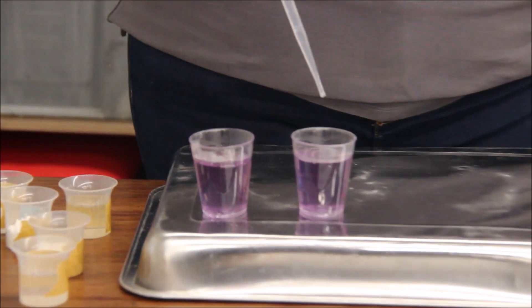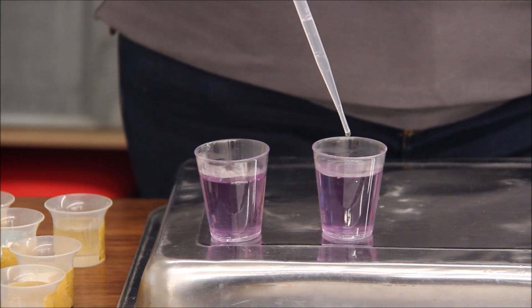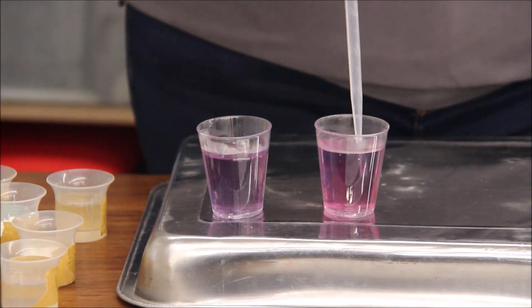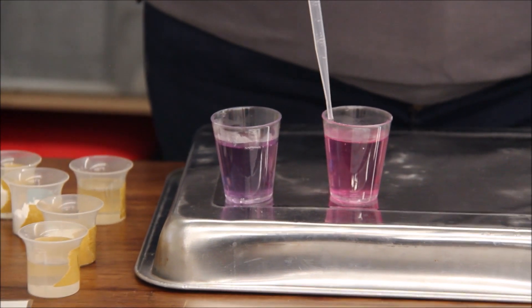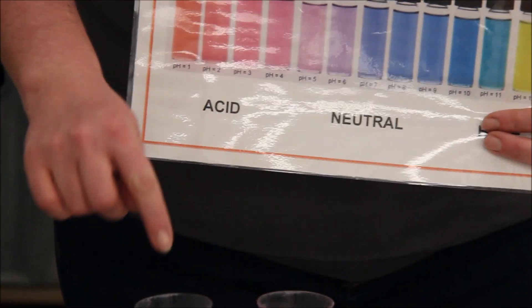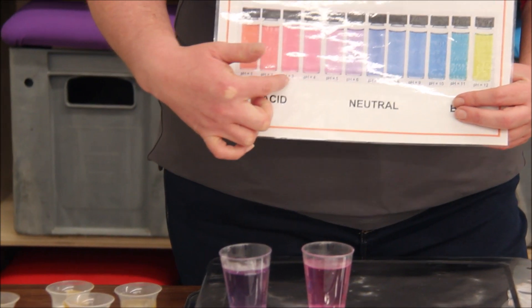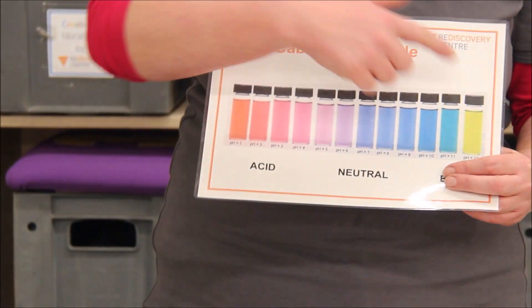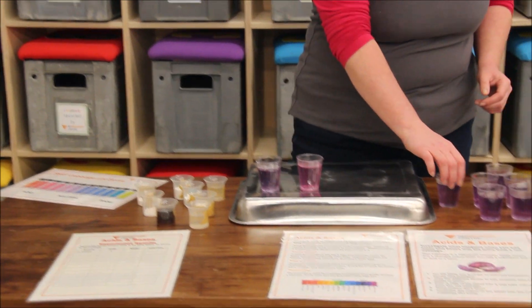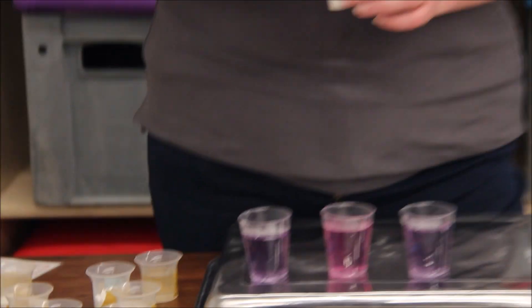I'm going to use my pipette and squeeze it in. So do we think this is going to be an acid or a base? Once I start adding it in, you can see that vinegar is an acid - you can see the colour change here from purple to pink. So it's an acid, around a pH of three or four, and the pH scale goes from one right up to 14.